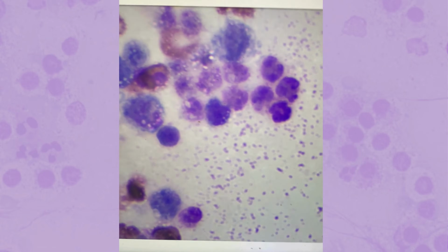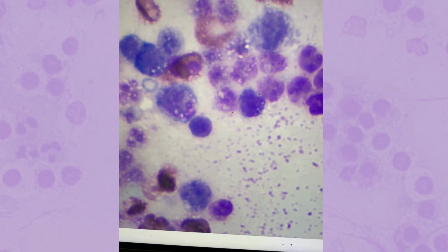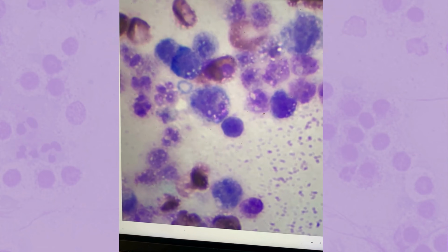So when cells become necrotic, you can't really tell who they are. It kind of depends on what stage of necrosis they're in, but if they're in a significant stage of necrosis, it's like, what are these cells? I don't know. They're just sort of smushy.